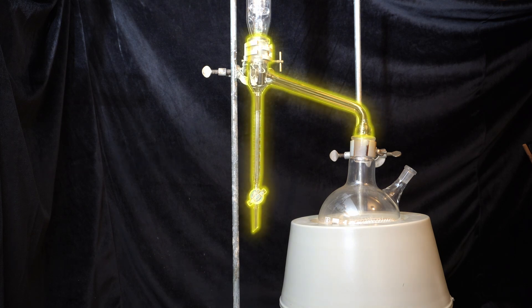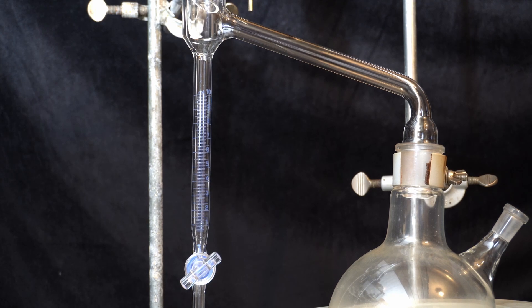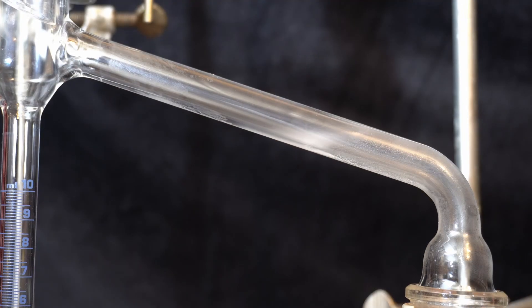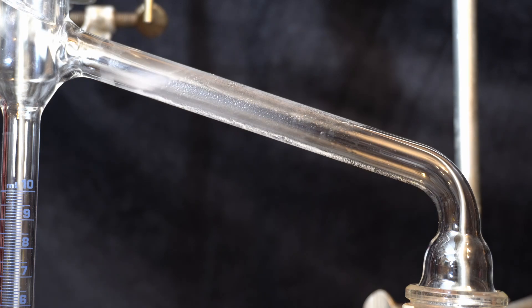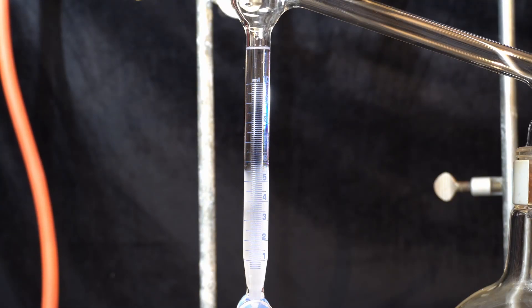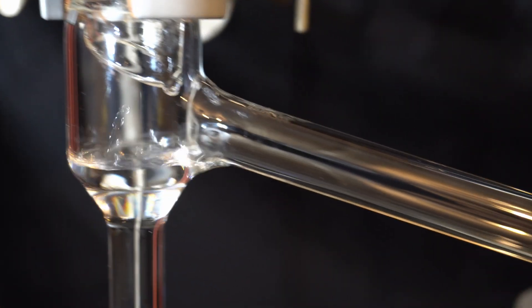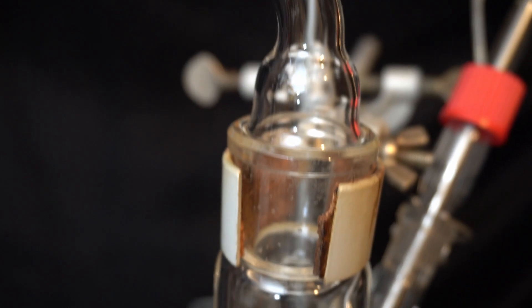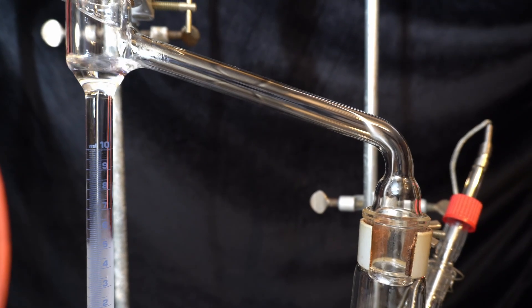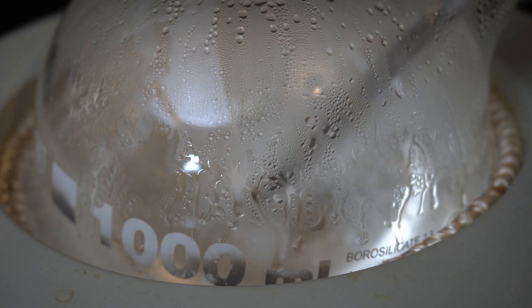This is where this piece of glassware comes into action. This is called the Dean-Stark apparatus, and it allows us to separate the water from the reaction by taking advantage of the fact that water and toluene form a low boiling azeotrope. When the toluene boils, it will co-distill with the water in the reaction flask, condense at the cooler, and drip down into the trap. In liquid state, toluene and water are immiscible and form two phases. The water forms a lower phase and the toluene fills up the trap and drips back down into the reaction flask. This cycle will continue until no more water is deposited in the trap, indicating that the reaction is finished. The beautiful part about this is that the process runs almost autonomously, and I only have to empty the trap a few times.